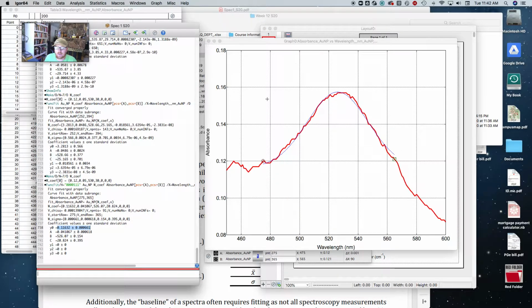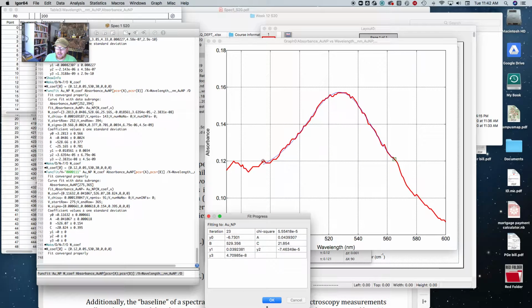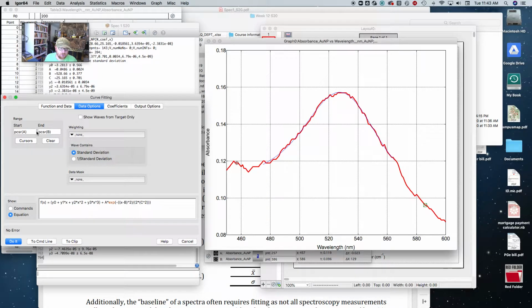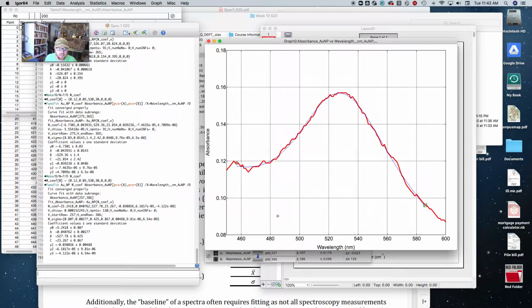And so if you get it to fit this Gaussian nicely here, then what you can start to do is say, okay, now I'm going to still leave the narrow cursors, and I'm going to uncheck those, and we'll say do it. And that's actually an even better fit. It allowed those polynomial terms to come in and have some kind of a value. And that's pretty cool. But then now I'm going to expand this out just a little bit more to include this shifting baseline. And again, you go to data options and push cursors if you update it. And now let's say do it. And all right, that's actually pretty decent.